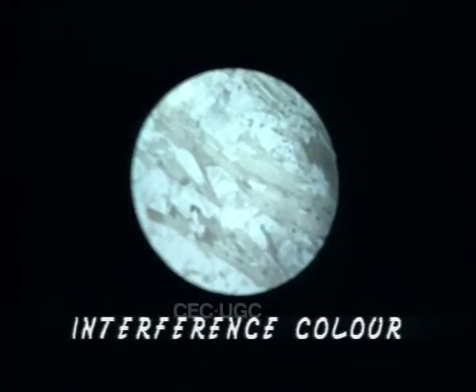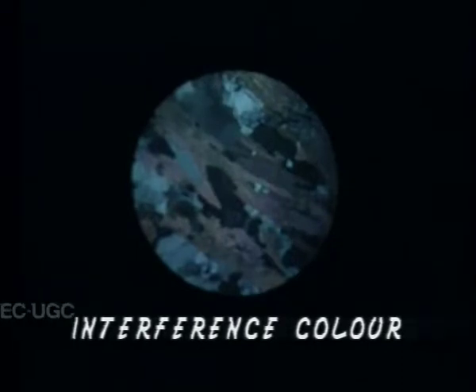We will now observe the minerals after inserting the analyzer, that is the upper polarizer, in the optical path. We find several changes in the appearance of minerals. Isotropic and anisotropic minerals can be readily distinguished in crossed position. Since isotropic minerals do not modify the vibration direction of incident light, the light transmitted by these minerals is totally absorbed by the analyzer.